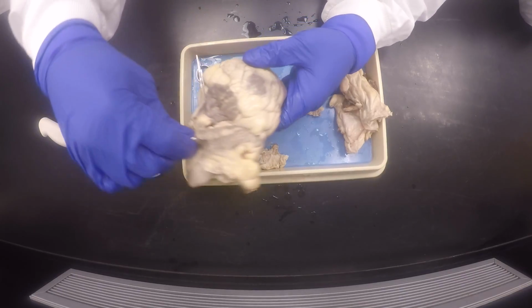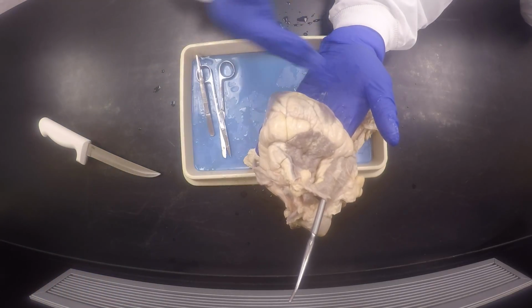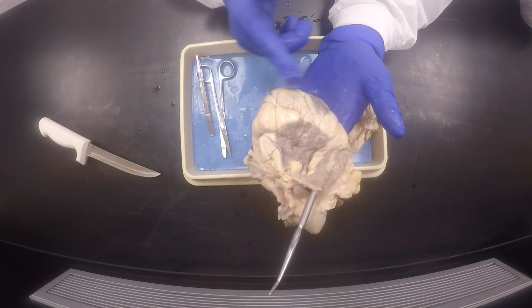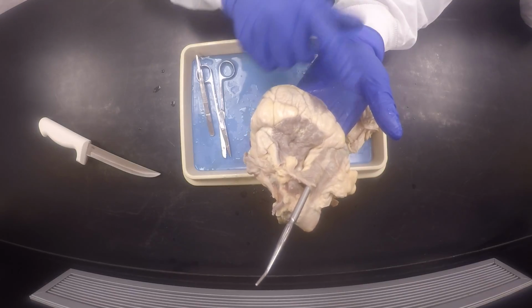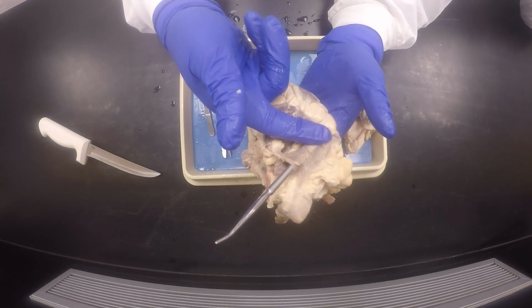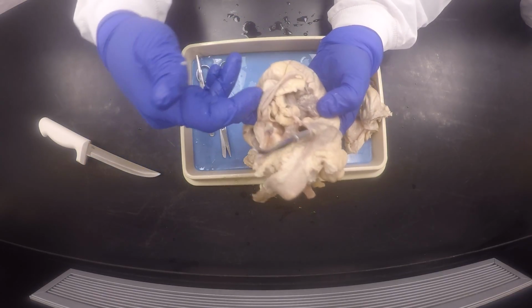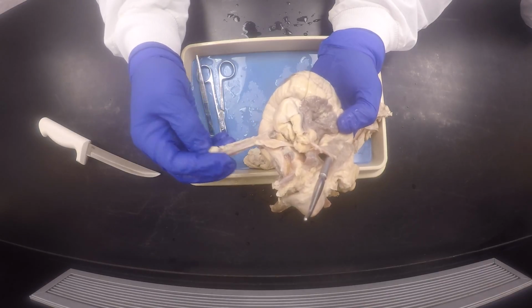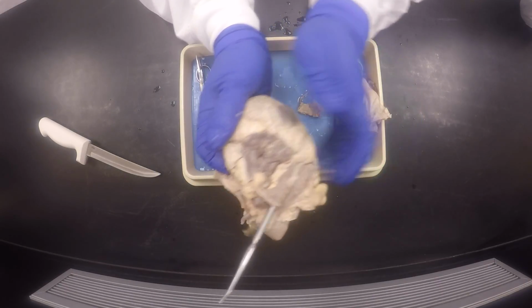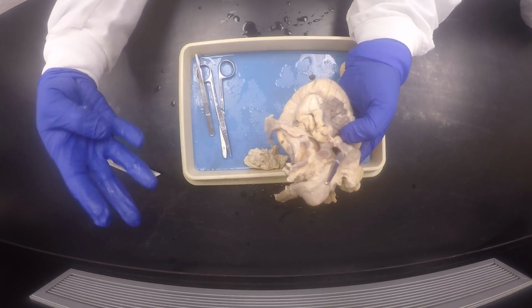And if I was to put a dowel in there, boom, you would see that it will go to the right side. So our little indentation that goes from the top right to the bottom left splits the heart into the side that has the tip, which will be the left side, and the side that doesn't have the tip, which will be the right side. So this is the right side of the heart, hence this is the pulmonary trunk getting deoxygenated blood to the lungs to pick up oxygen. It comes back to the left side carrying oxygenated blood. This side containing the apex is the left side, and the left ventricle is bigger than the right ventricle. So this will probably be one of the four pulmonary veins that go into the left atrium.